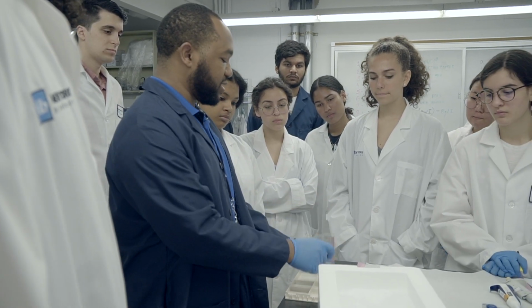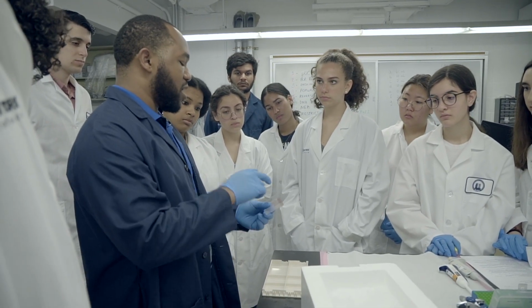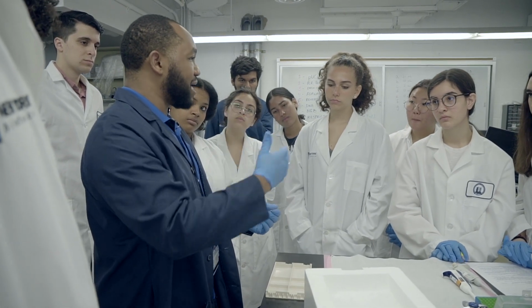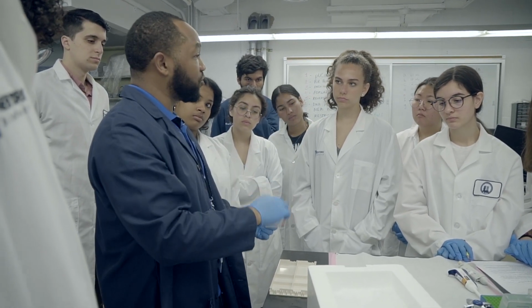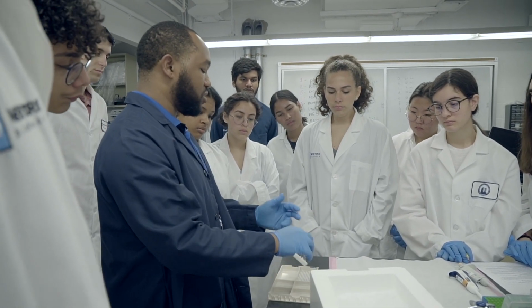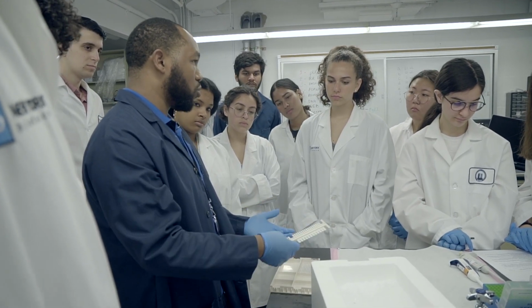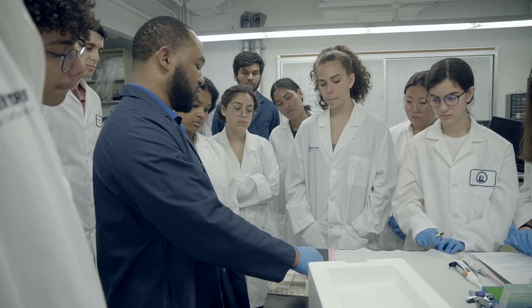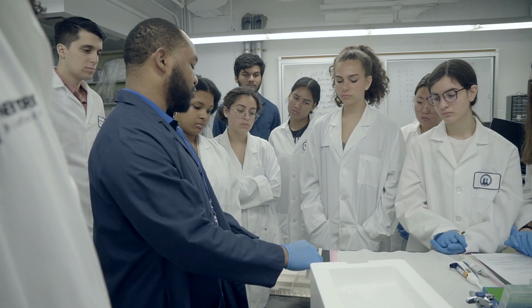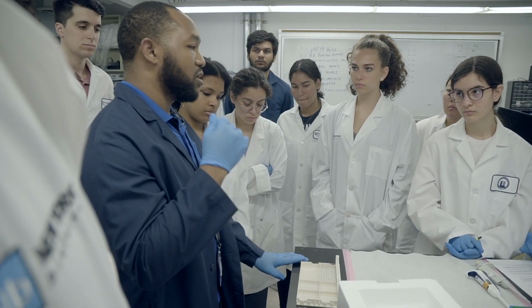This plastic case is what we're actually going to put into the gel electrophoresis box. The lines, as well as the top band, help us visualize as the gel is running where our colored bands are going to be. So we put this in first, and we put the teeth in on top. The wide versus the thin doesn't matter too much, except the thinner one gives you more potential samples. So I'm going to use this one. It has a total of 17 teeth, so 1 ladder lane plus up to 16 samples. Okay, and so I'm going to put that there, and then I'm going to get my TAE, add the buffer.